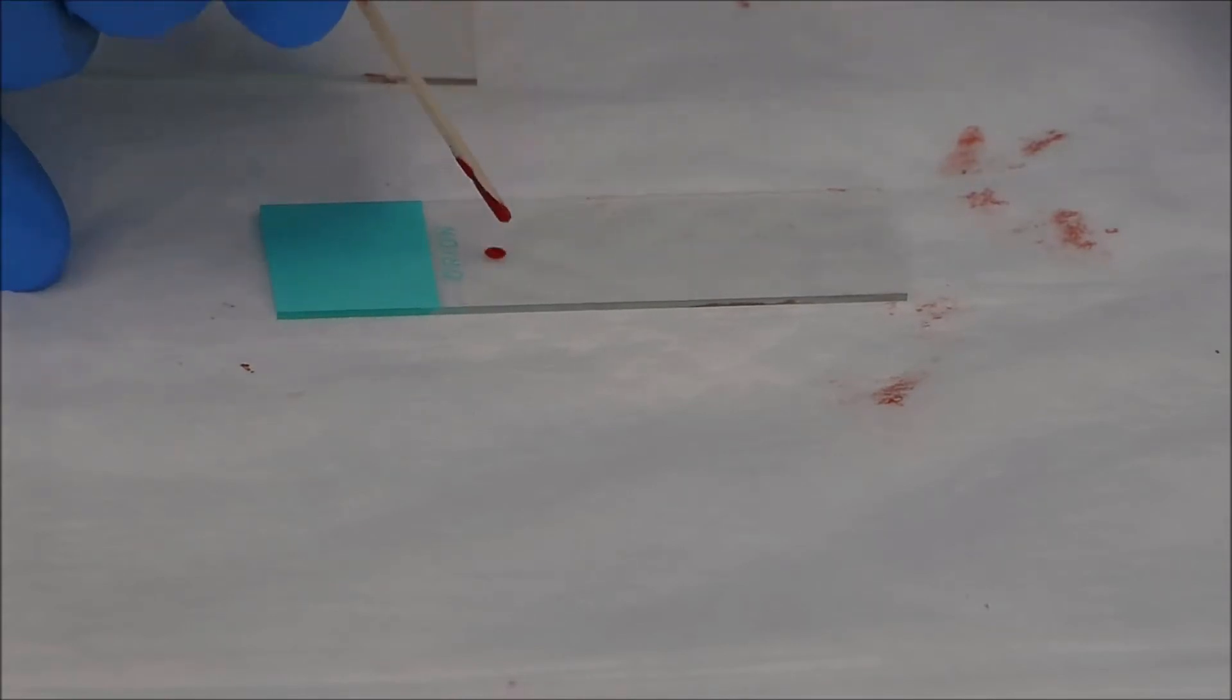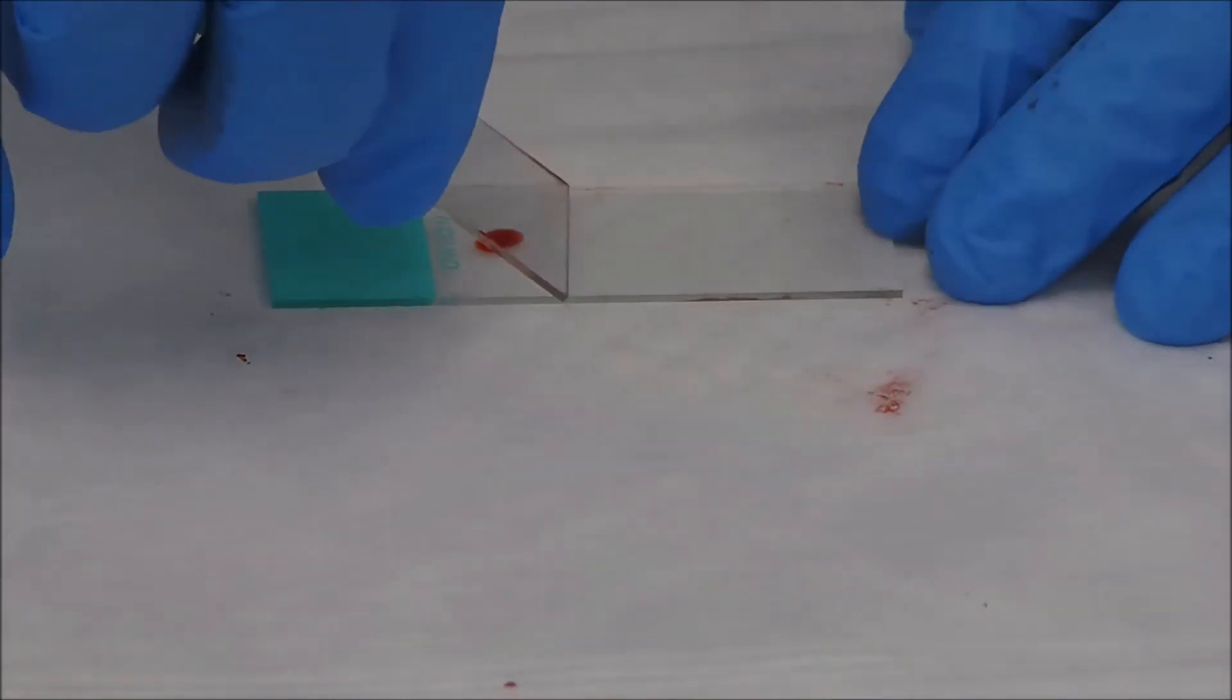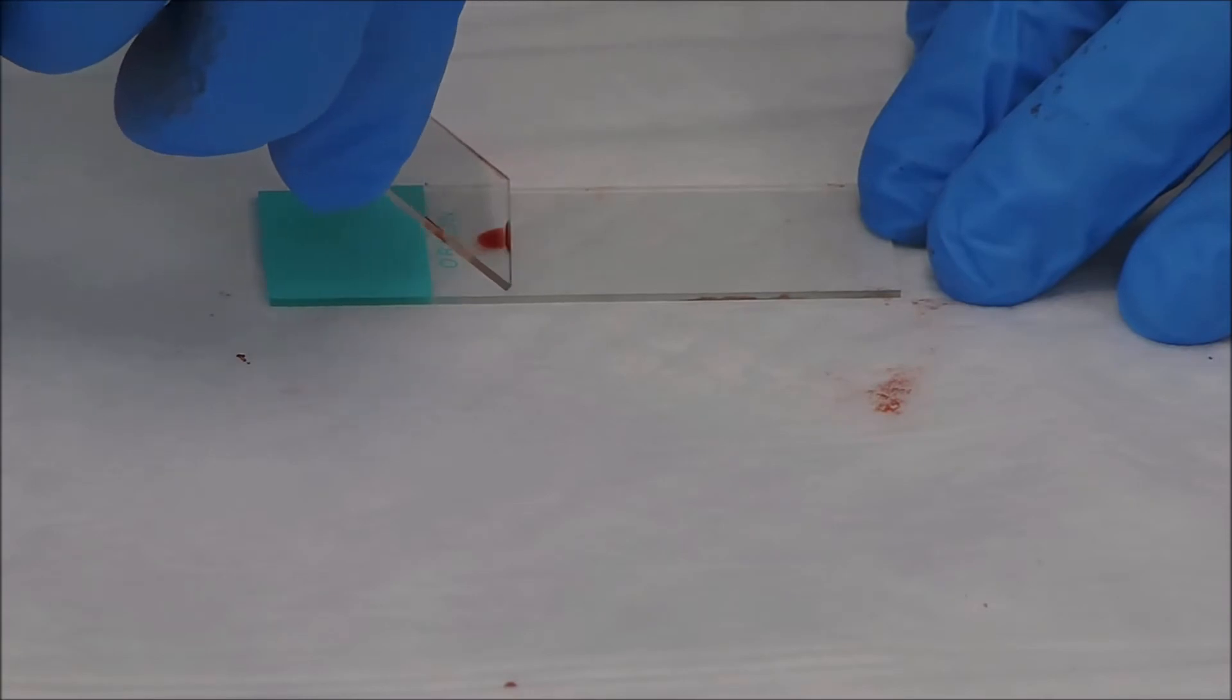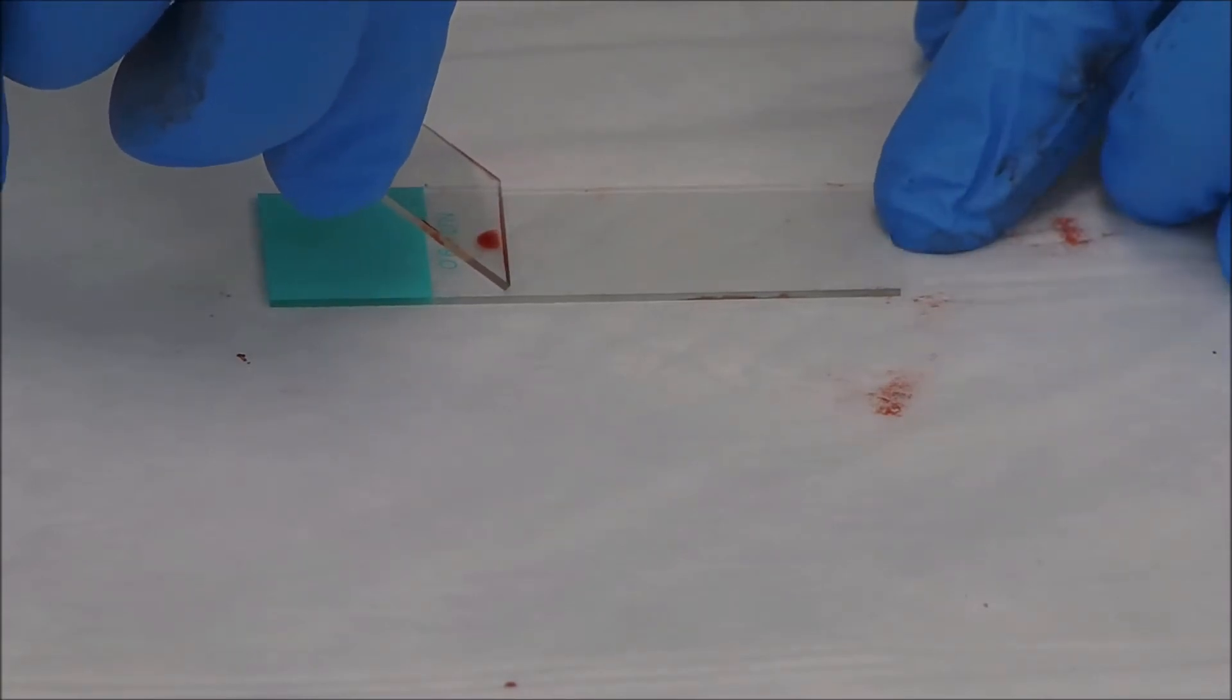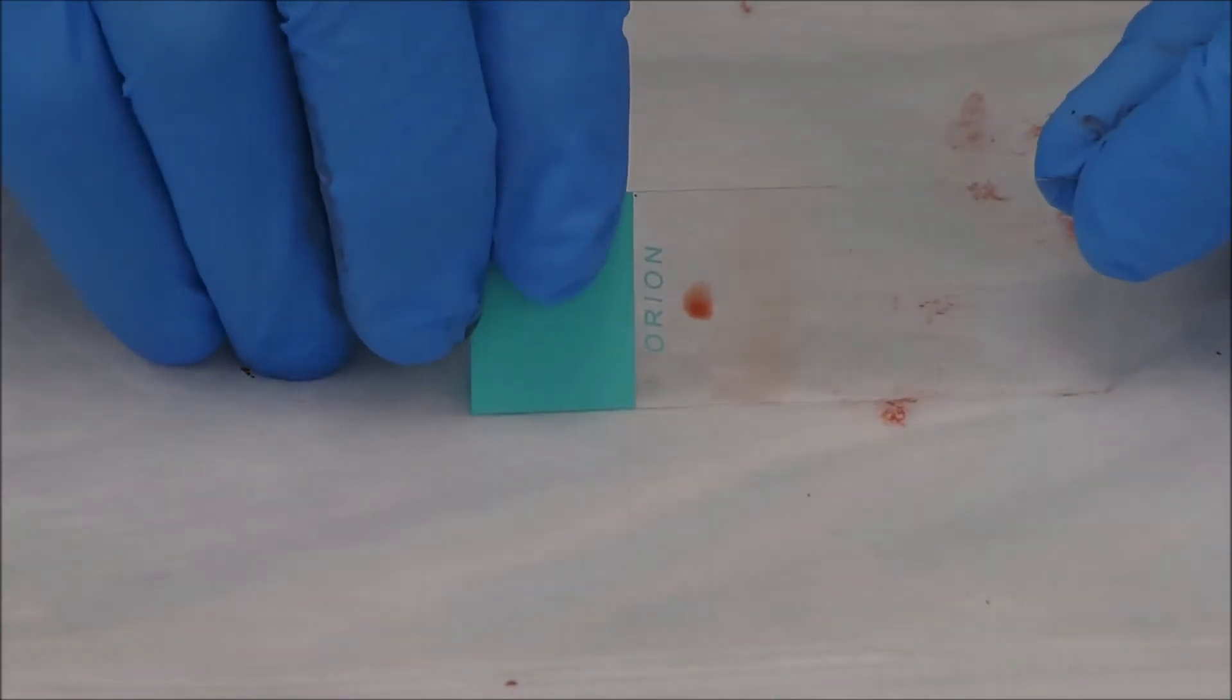Okay, so we'll get our blood sample. Nice big fat drop of blood. Maybe too much. So I'm going to make it a little bit taller this time and see what happens. Okay, into it, and then forward. You see, that one made it very, very short. So that's no good.